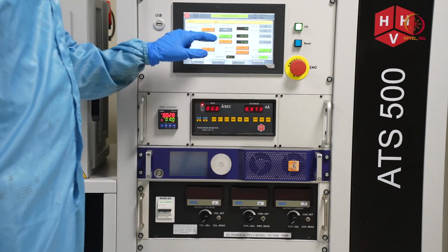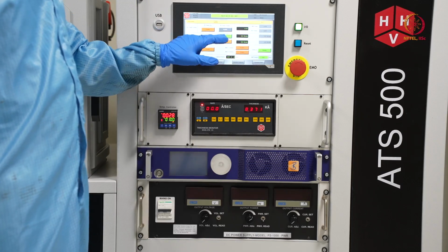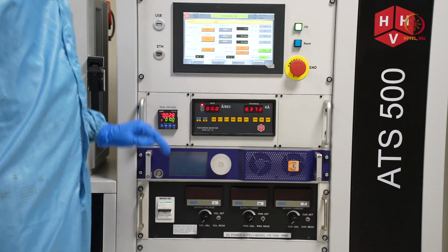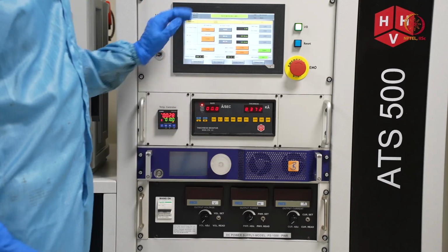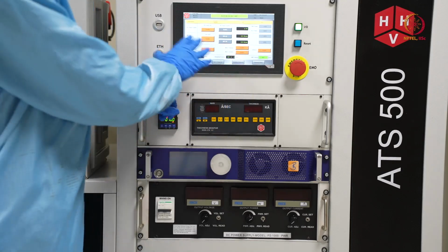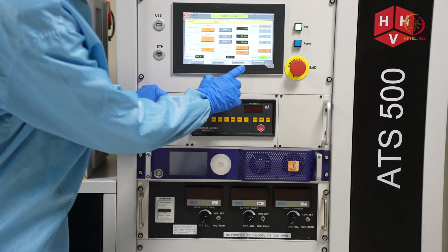Now if we consider this mass flow controller, this also you have to switch off. First set 0, so flow will be stopped, then disable that MFC argon and then close the gas valve. So this part is done. Before leaving this window, we should stop this DTM also, because we cannot do that from outside. From this window we either turn off or stop everything. Now we will go back to system control.